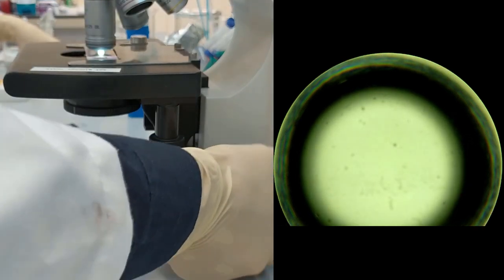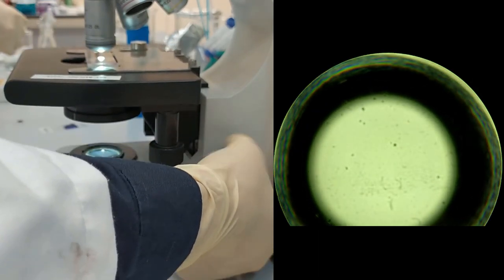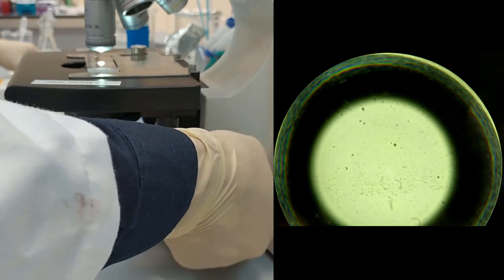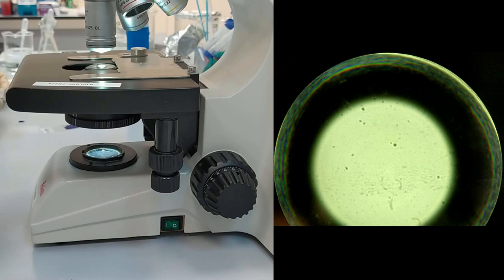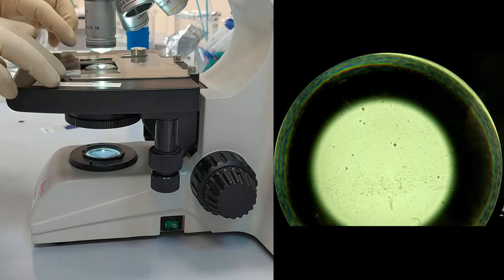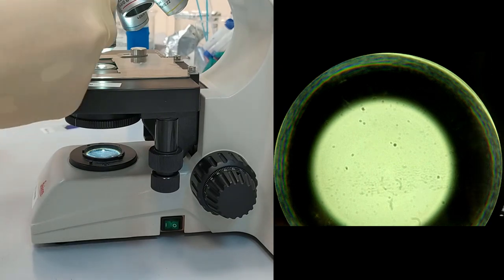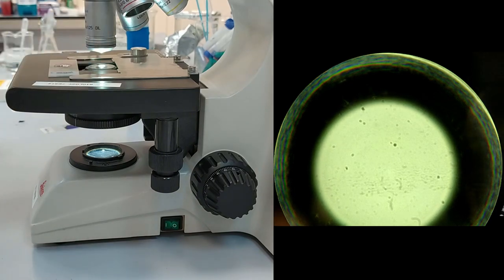Now to remove the sample, we again lower the stage to the maximum. Remove our sample, place the sample with Staphylococcus aureus, and drop oil on it.